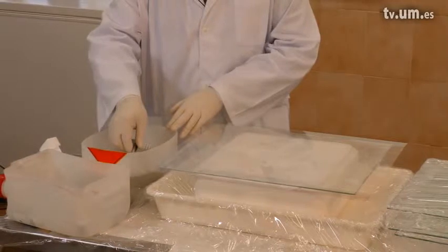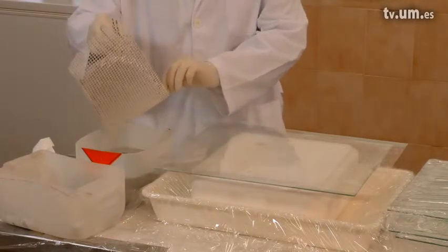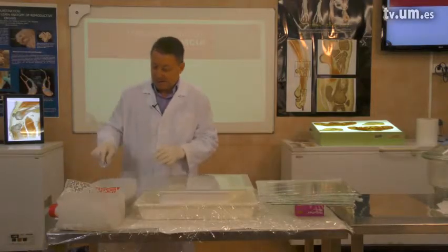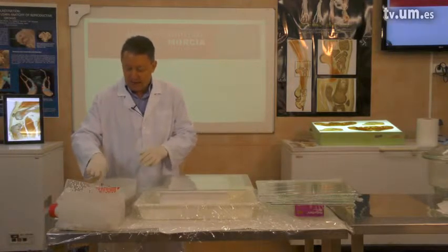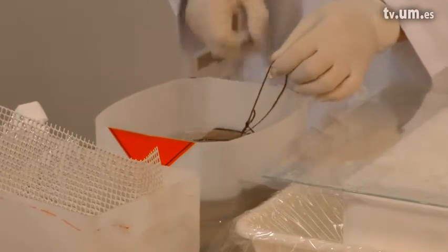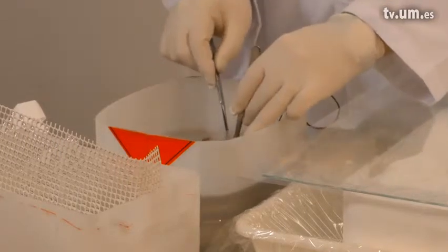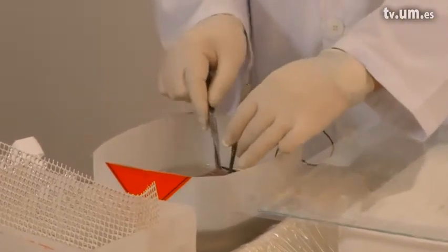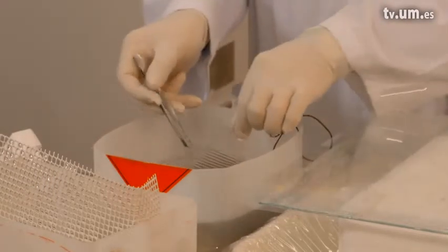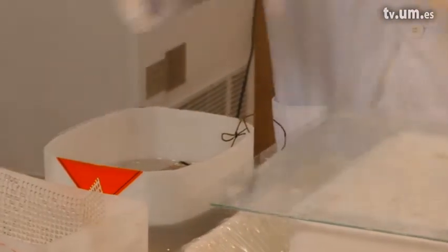We have here our impregnation bath, but we have to remove the covering grid, letting excessive resin ooze out. Always have a container nearby where you can drop your used grids. In the resin bath you will have your stack of slices which are now impregnated. You have to lift them easily out and open the stack of slices. After opening and cutting the ropes which keep it together, we remove the first grid and now we are preparing the next step — the sandwich building step.